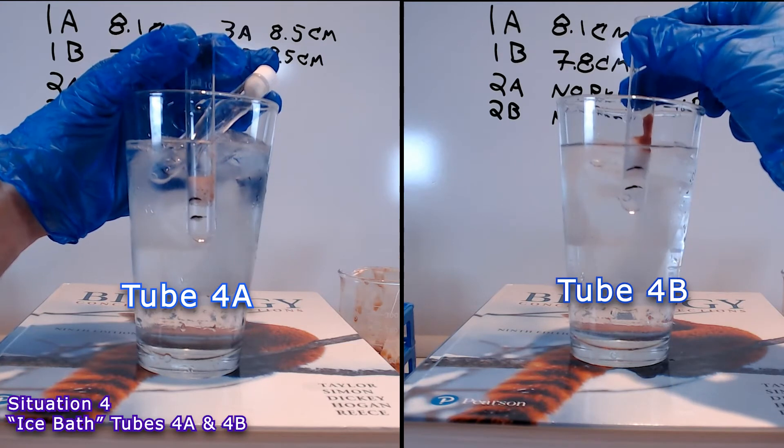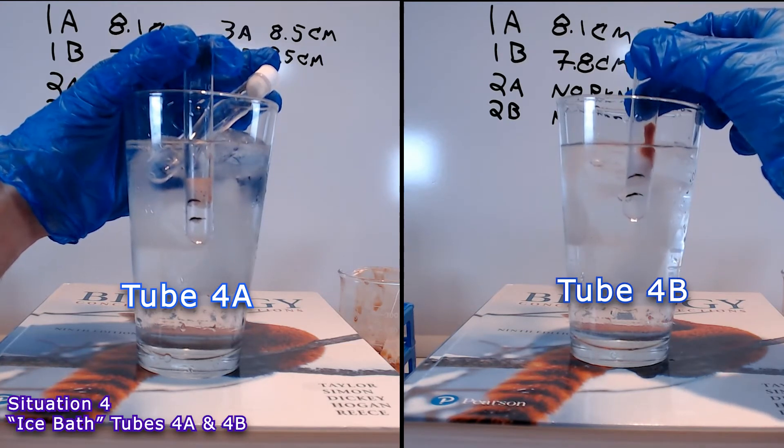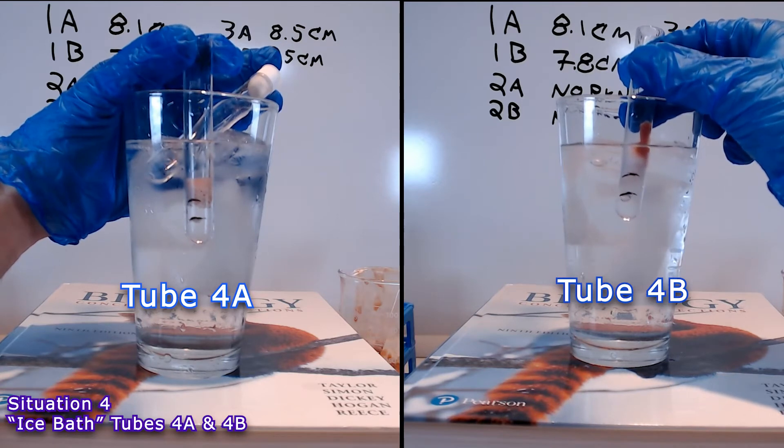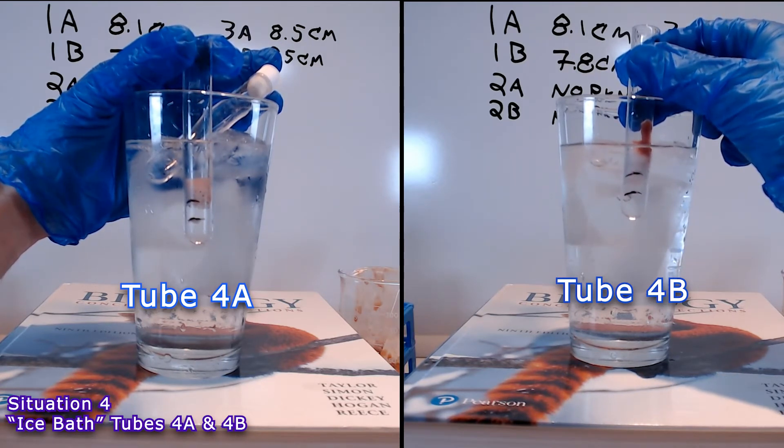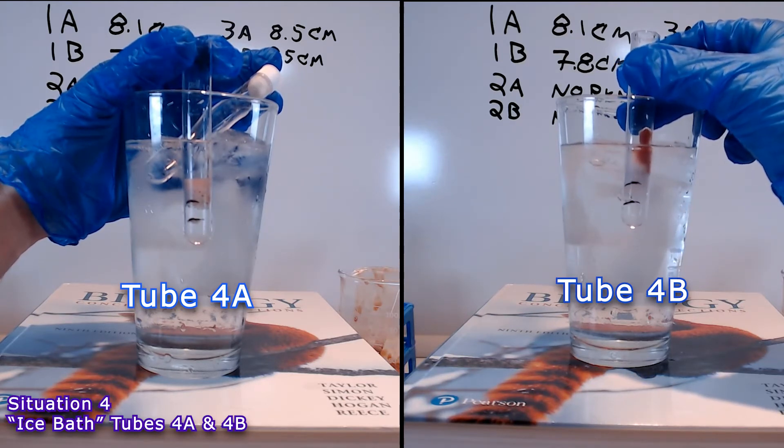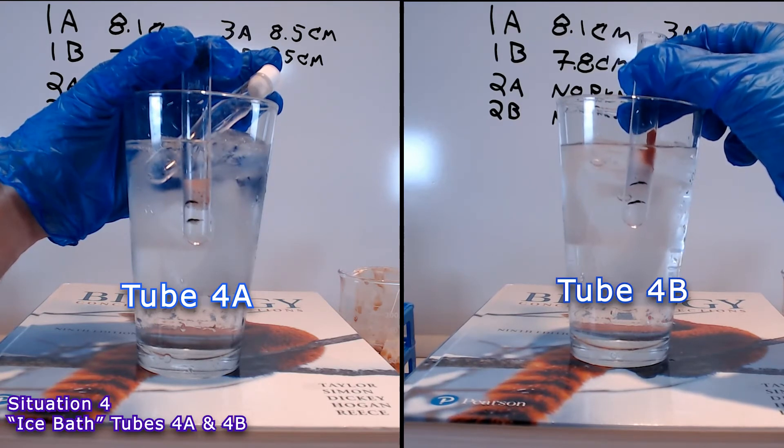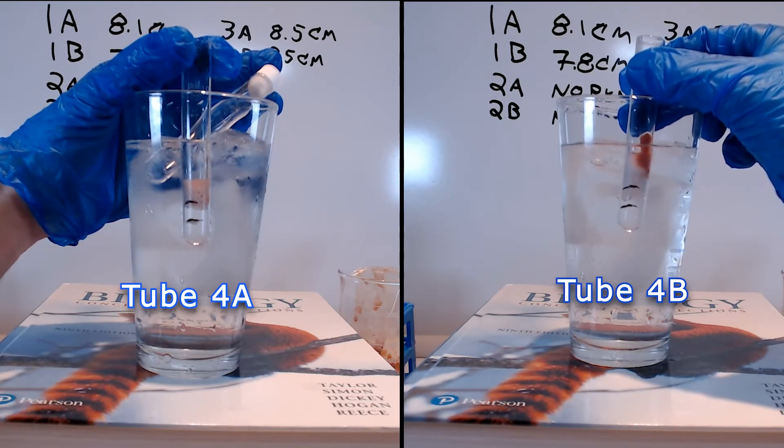And they grew pretty slowly compared to the other situations. The other situations where we did see a reaction, it shot up relatively quick. But these took a little bit to get up there, even to that shallow height. I kept them in the ice bath for a while because they were still ever so slightly growing. So, I wanted to make sure that I didn't miss it.